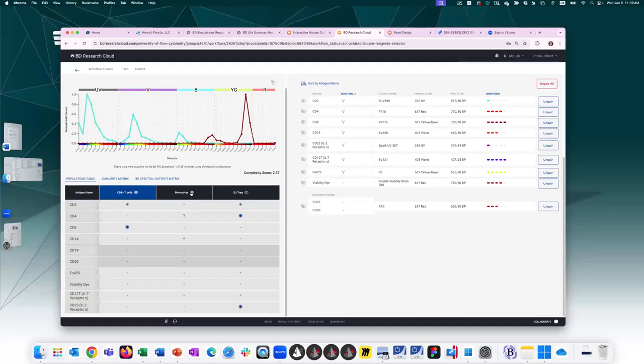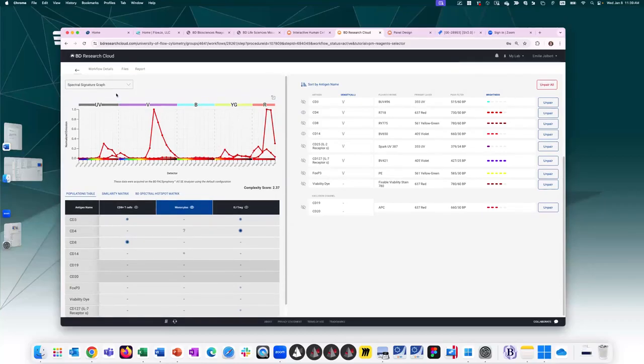So if I move on to my next population, monocytes, now I can evaluate with these two fluorochromes that have been assigned to them. This was the CD14 and CD4, because I left it as, who knows, maybe monocytes do express low-level CD4. So I can assess, do I anticipate any issues between these two fluorochromes? In the spectral, I can look at it and assess if this is acceptable.